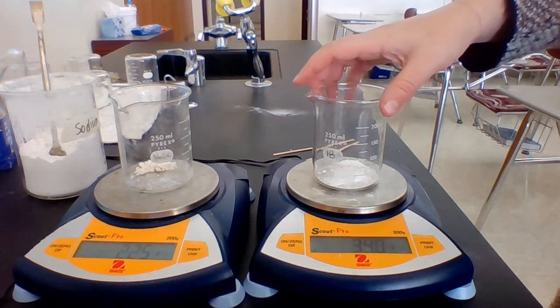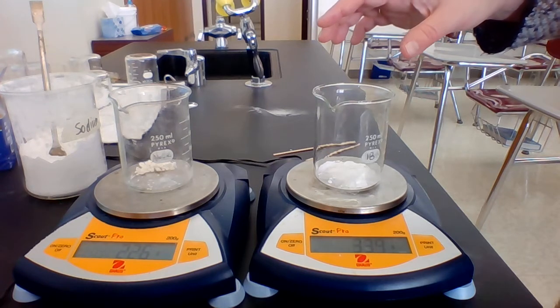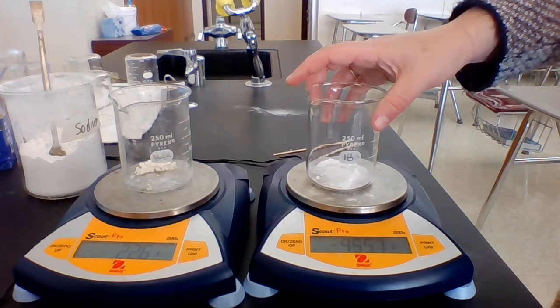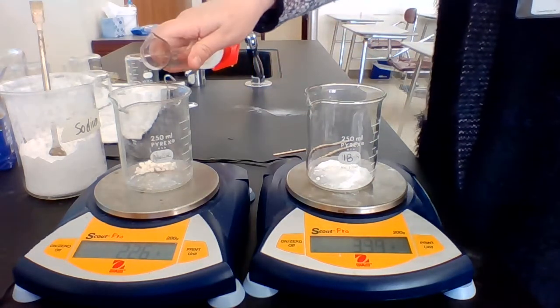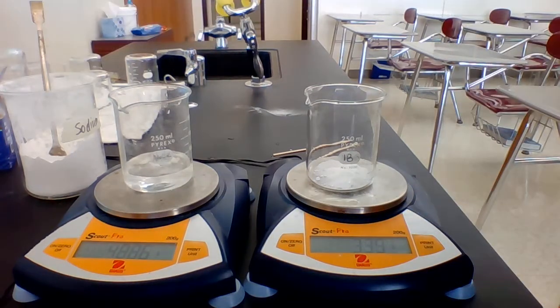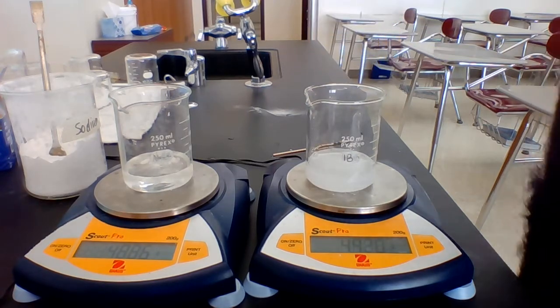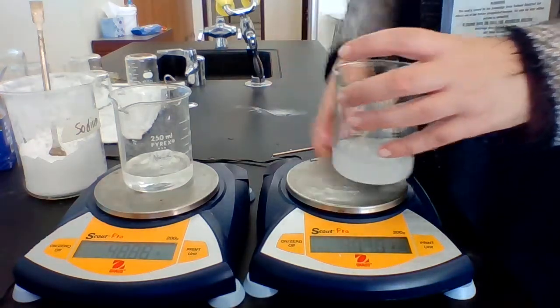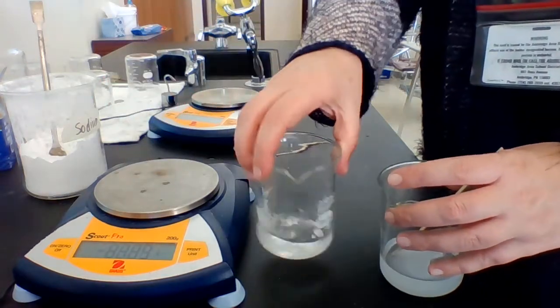As far as the sodium bicarbonate, same thing. I couldn't get it perfect, so I have 3.39 grams of sodium bicarbonate. Now, if I put them together in their current state, they're not going to react. So actually, I'm going to mix them both with water. I'm going to dissolve them both, and then mix them to get them reacting. They should both completely dissolve, and it'll take a minute, which is fine. But they will both completely dissolve eventually.